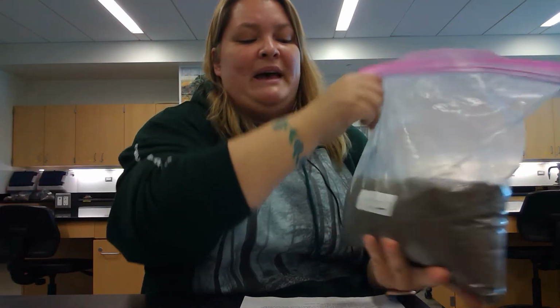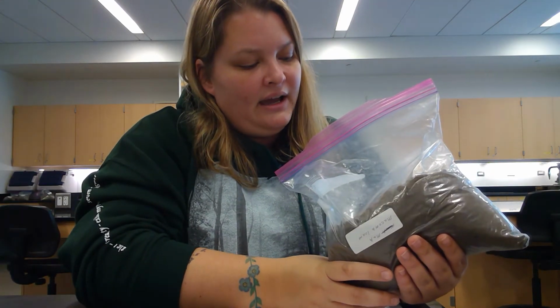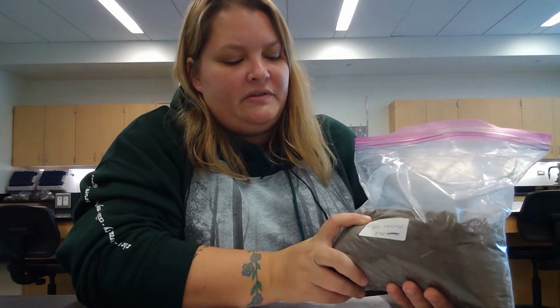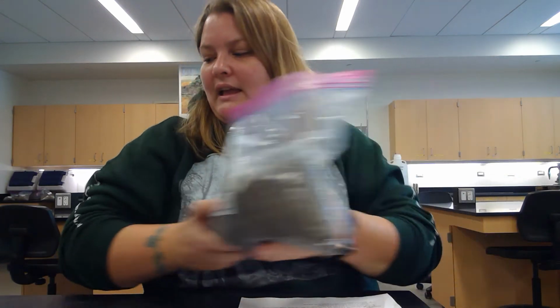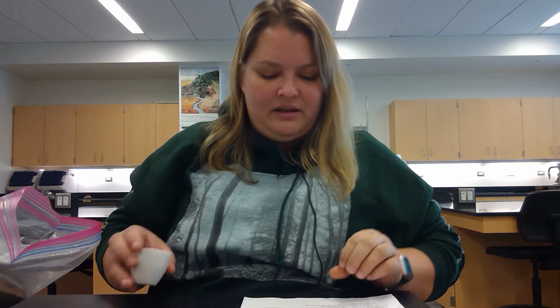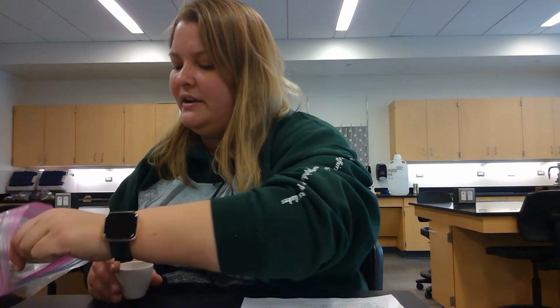All right, so now we're going to start with our coarse textured soil. And our coarse textured soil we're going to use is this Macloam loam. So it is a loamy soil, but it has a lot more sand in it than a lot of the other particles. So it's more of like a sandy loam. And that's going to be our coarse textured soil. So I'm going to add it slowly until the crucible level is full. I have my handy scoopula here.